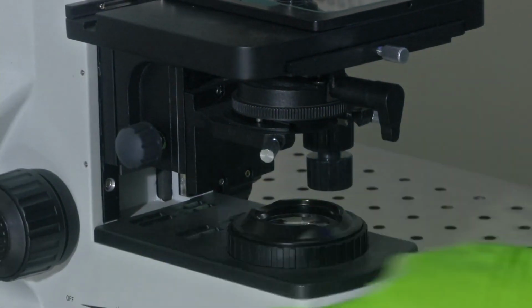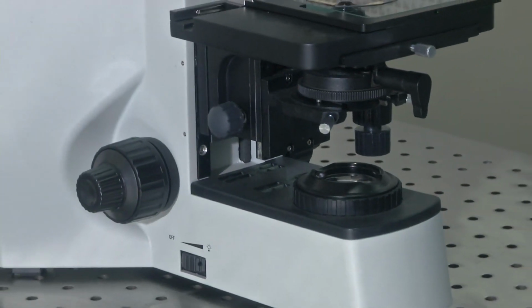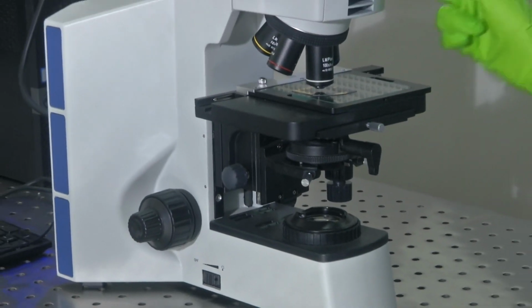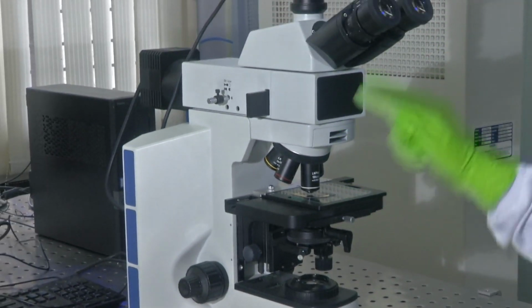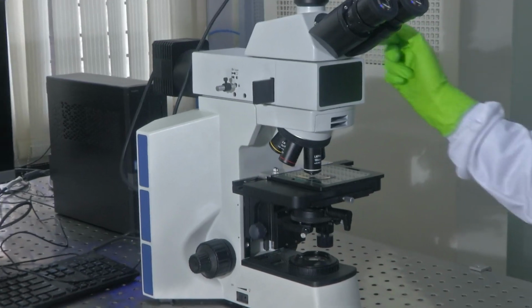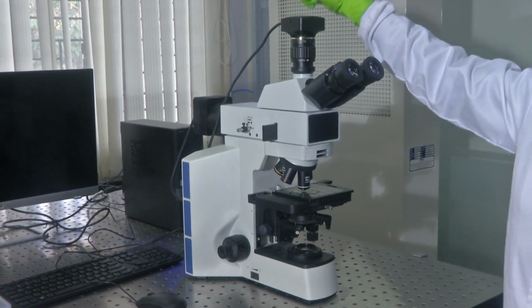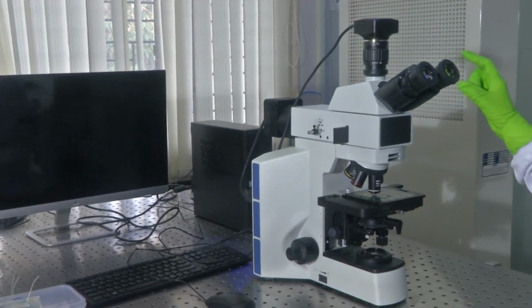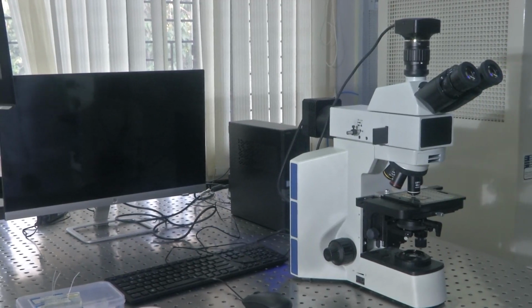Now let us see, this is the bottom light source, and this is at 100x. This is a knob which is provided for the bottom light source, and like I mentioned earlier, there is another light source at the top. So, you have 2 light sources for this microscope, and there is a camera, which in this case we have attached to a system here. It has this port which goes to your USB port and to the system, and what we could see in the eyepiece is directly imaged through the PC here.